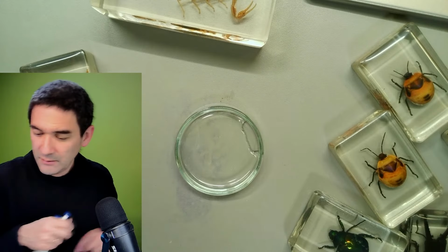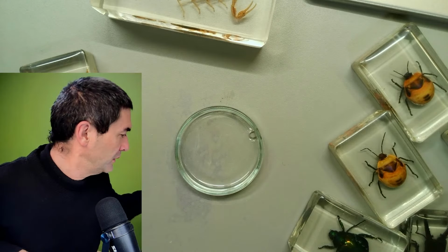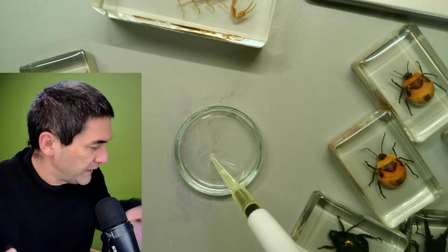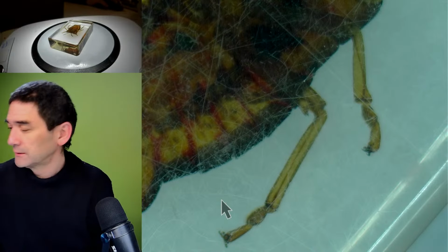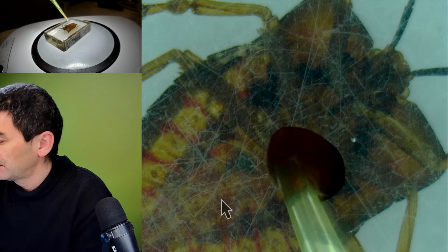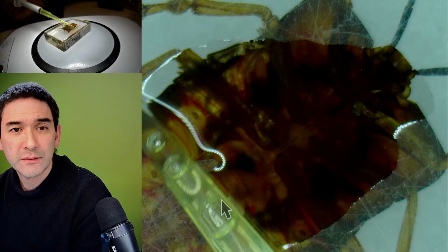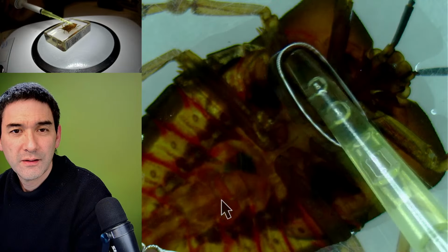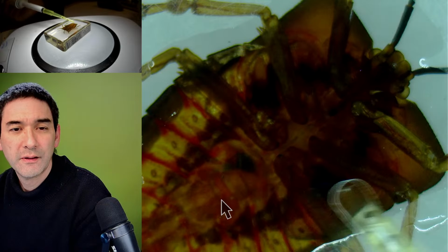Let's try this again. I'm looking for, here they are, the tips of my pipette. And let's see if vegetable oil is able to do the trick. So here we go again. Let's see if we're able to remove the scratches this way. You see, that's the problem, of course, it spreads much better. This is nice. Look, I think this did the trick.